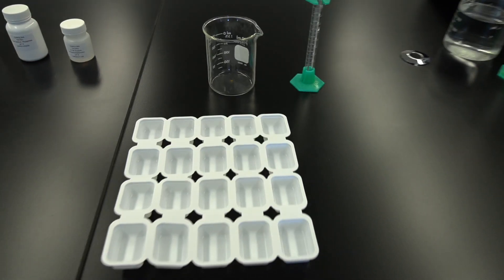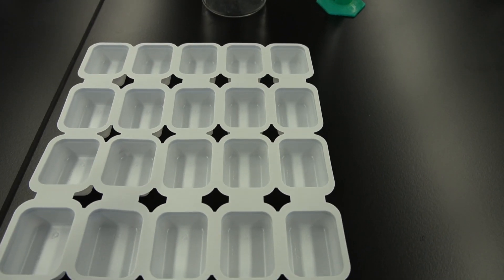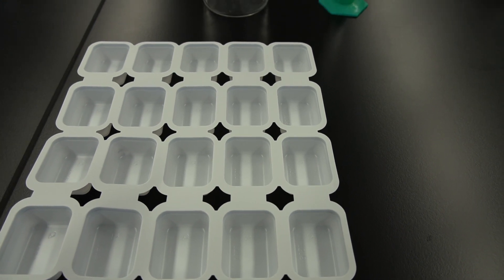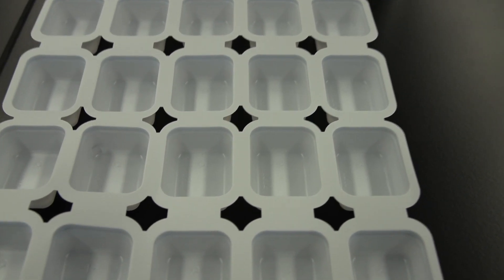Turn the jelly tray so that it has 4 rows by 5 columns. Use the grease pencil to label the wells of the jelly tray. Label the rows A, B, C, and D. Label the columns 1, 2, 3, 4, and 5.